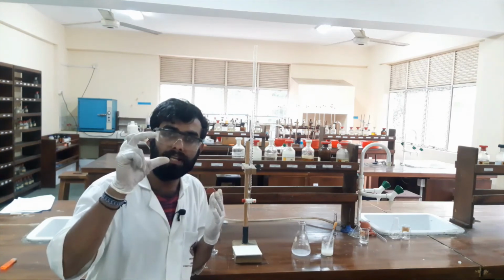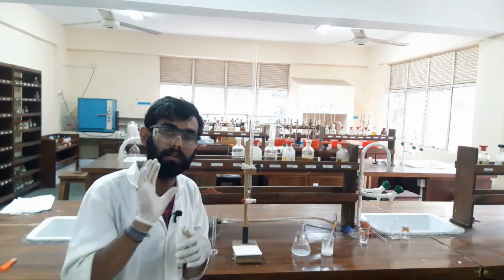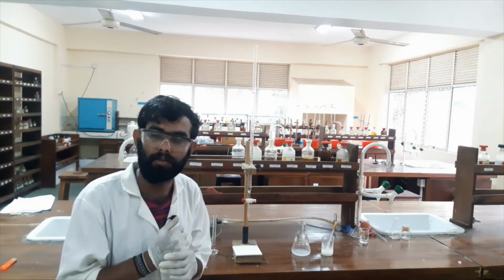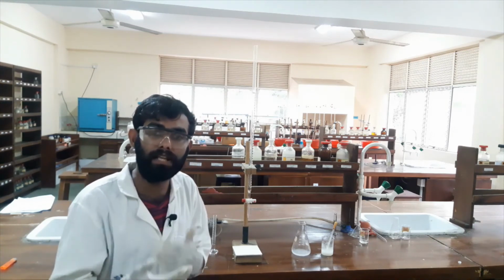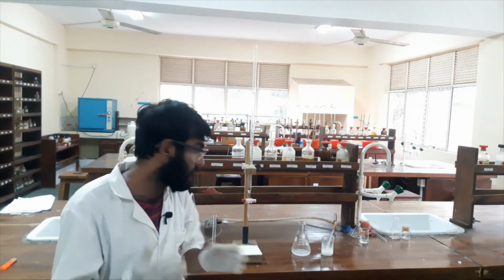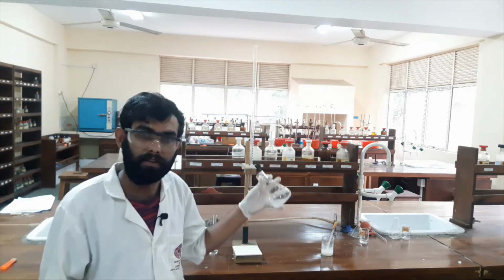The trapped iodine in the starch iodine complex will be released, and potassium thiocyanate molecules will bind to the starch and replace the iodine sites. Okay, the iodine will be released, and that iodine will again give a blue color. So we do our titration again until the blue color converts into a milky color. That means there is a precipitate in the solution, that's the copper iodide precipitate.